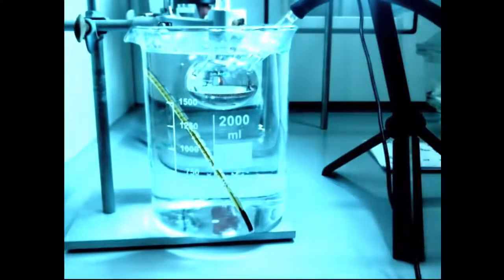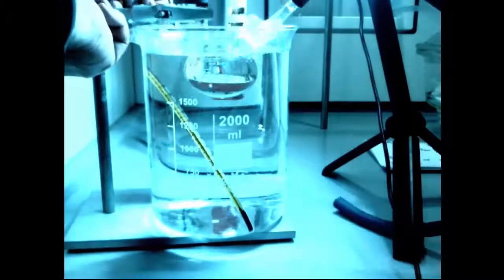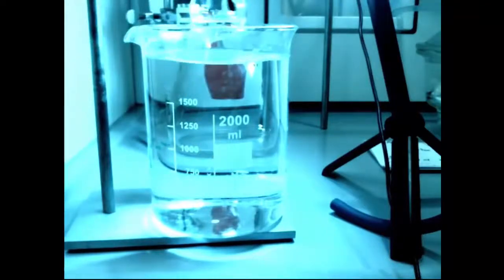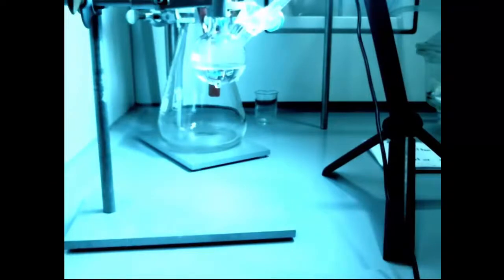This is at 40 degrees, but we'll see in a moment that it will carry on boiling if we take it out. But even at good vacuum, with nothing in there, with no surface to nucleate the bubbles, it goes past boiling point effectively. It refuses to boil. So here I am, boiling it a few times. Now I'm going to take it out and boil it at room temperature. So now without the hot water connected, we can see it will boil perfectly happily on its own.